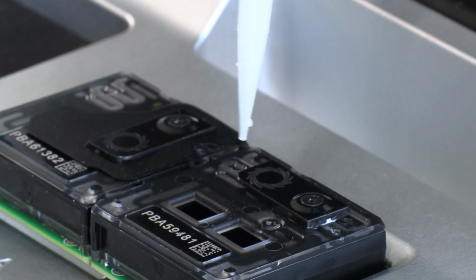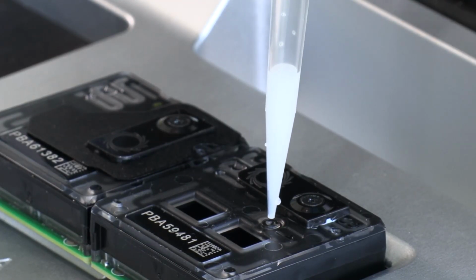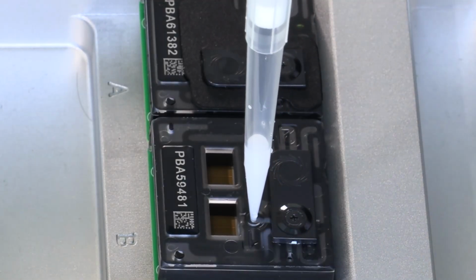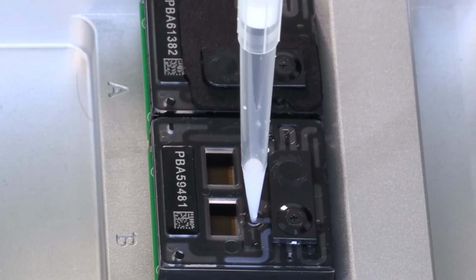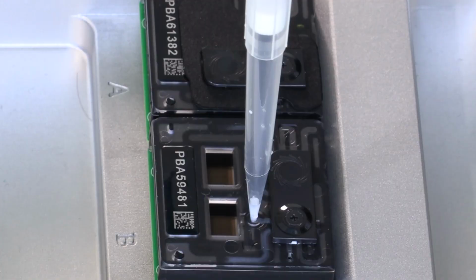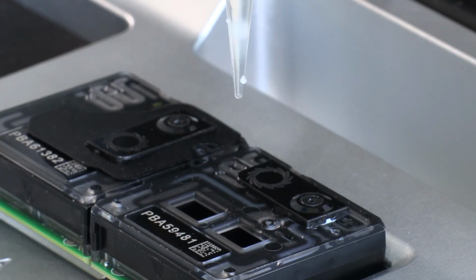Check that there is no air at the end of the pipette tip. It is also always recommended to hold the pipette tip vertically to avoid any air coming in. Insert the pipette tip into the flow cell and once again, carefully and gradually expel the library into the flow cell. You can see that the library loading beads are now visible in the channel. So this is where the liquid is going into the array. And as previously, leaving a little bit of liquid behind to avoid any bubbles.